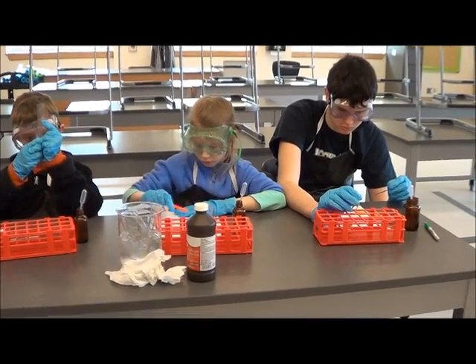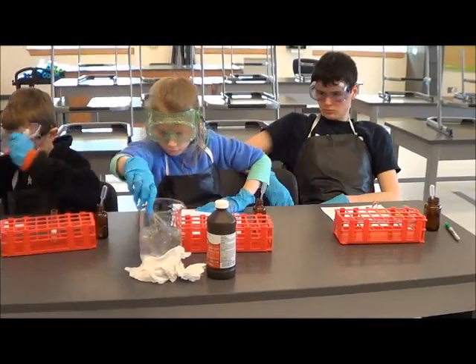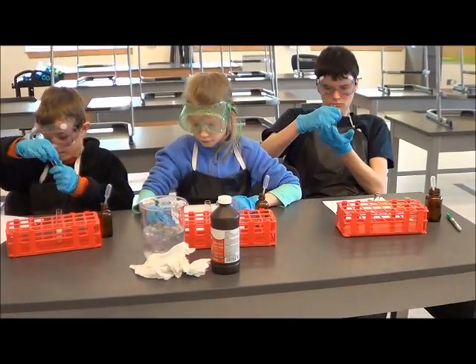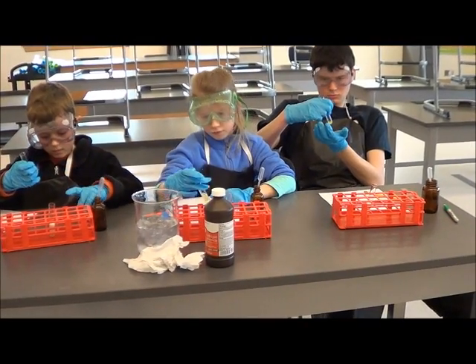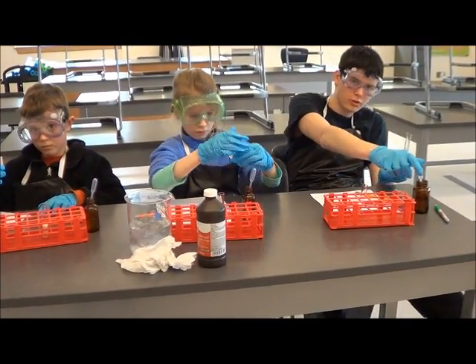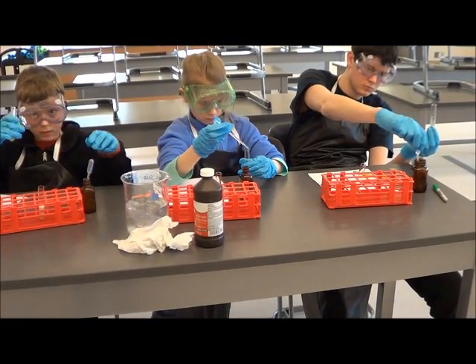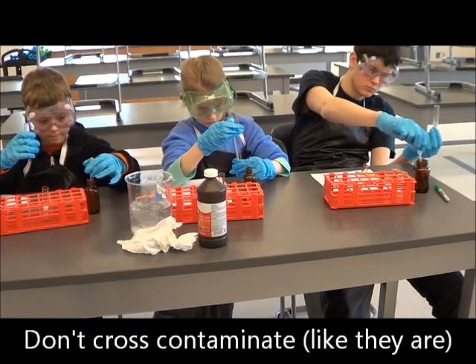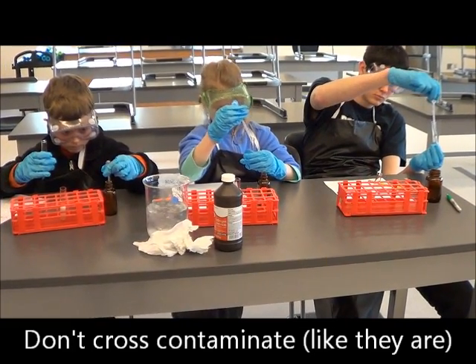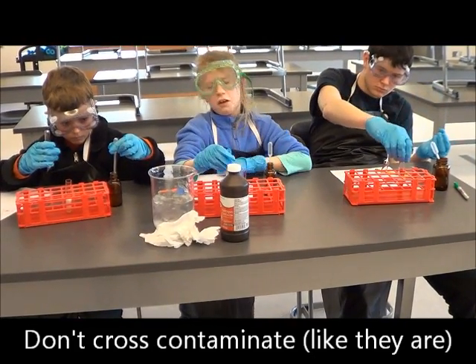Science girl, do you think you can find which test tube is your cold one? Okay, very good. So then you guys can put one milliliter of hydrogen peroxide — the brown stuff — in those. Just one milliliter. You should put it in the test tube holder, science boy or science helper. Okay, then put it in and wait one minute.